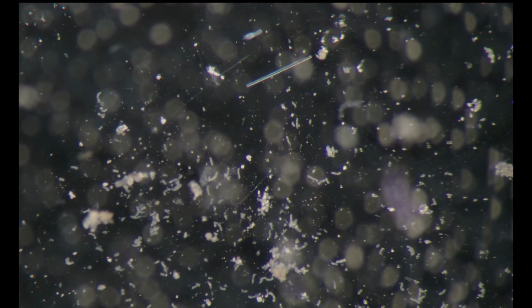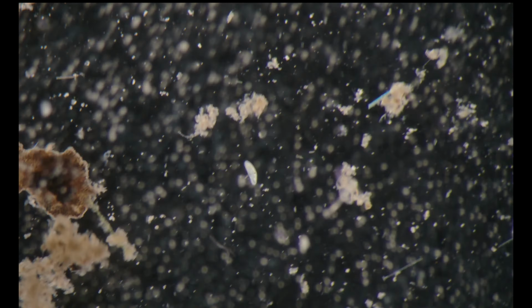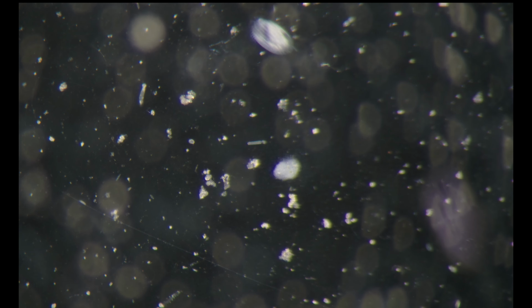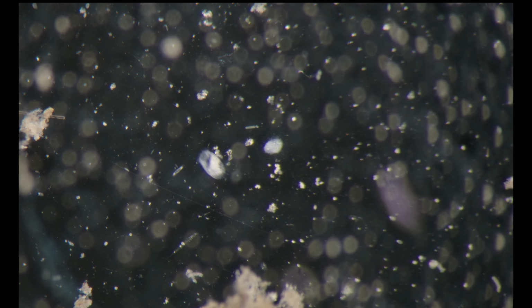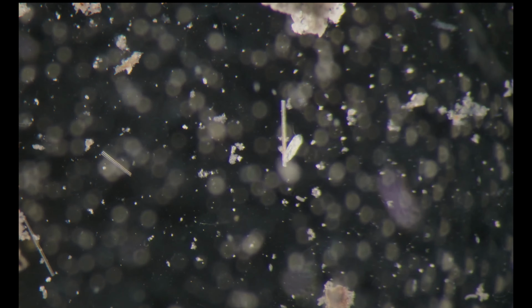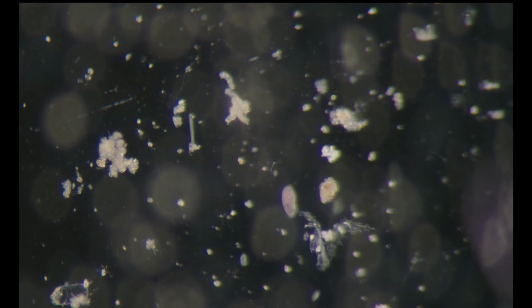You can do it to a certain degree, of course, with 4 or 10x objectives on an upright without a cover glass, and then pipette from there, but you lose the zoom ability, and of course the most important thing is the upright position of the head, or here is a Spirostomum, and the ability to see a 3D view, which is very helpful with manipulation.